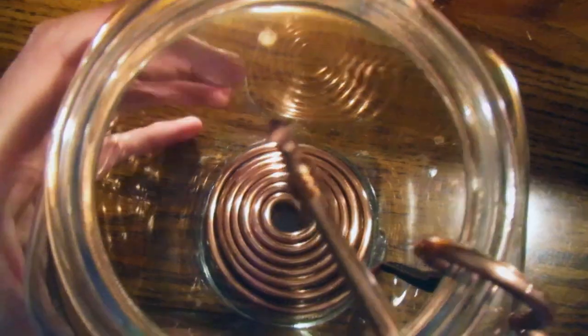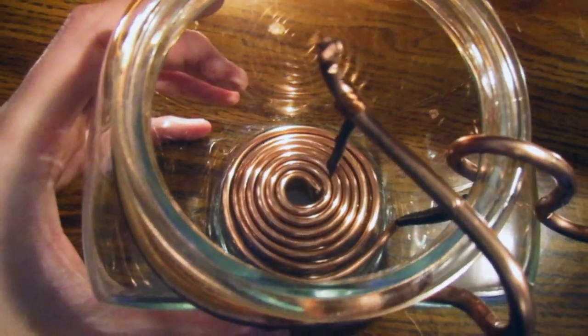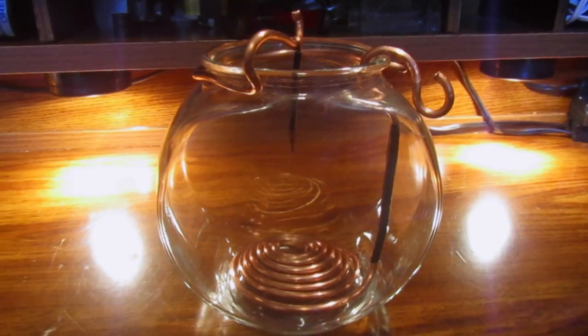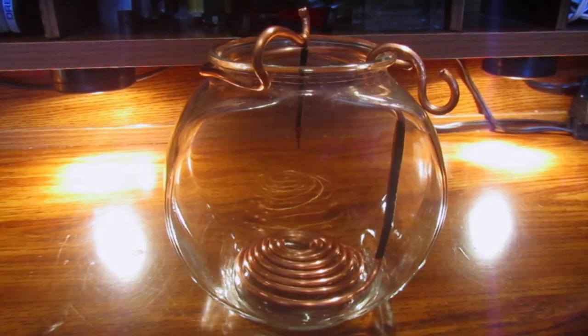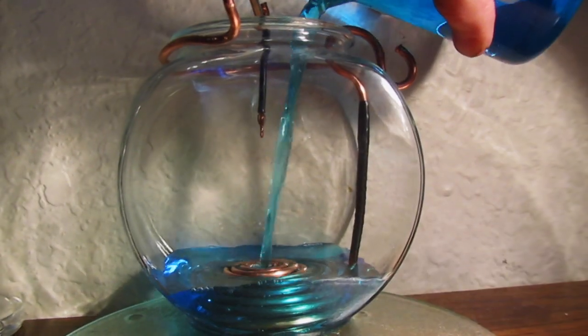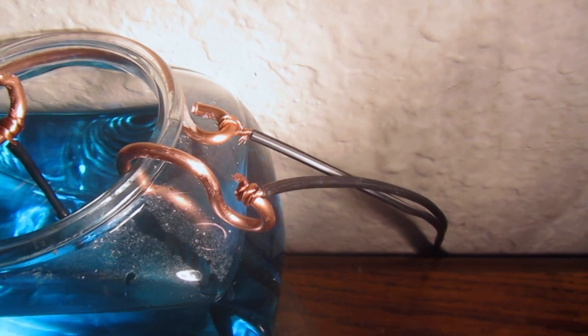For the negative side, which will be the one receiving the copper, I just hung a little wire over the center of it. Now I'm pouring in my copper sulfate solution. I use a strong solution to better conduct electricity and I wire this up as follows.